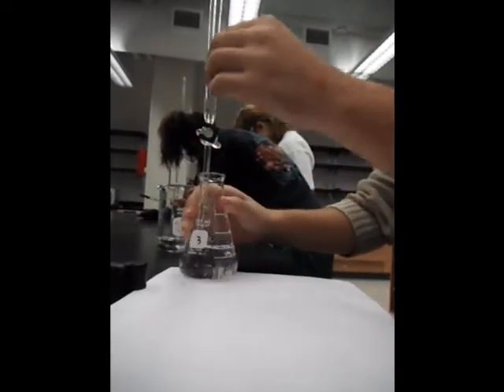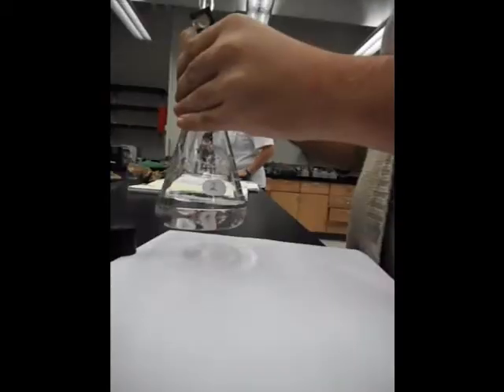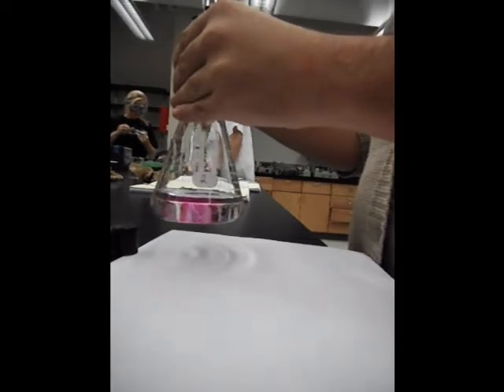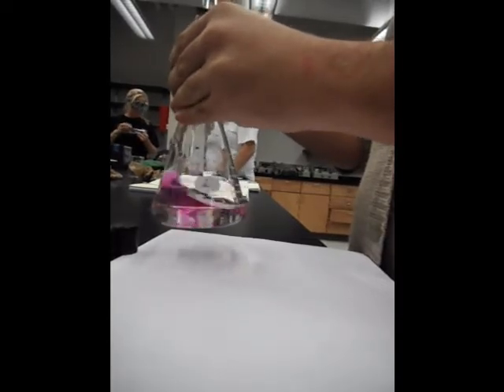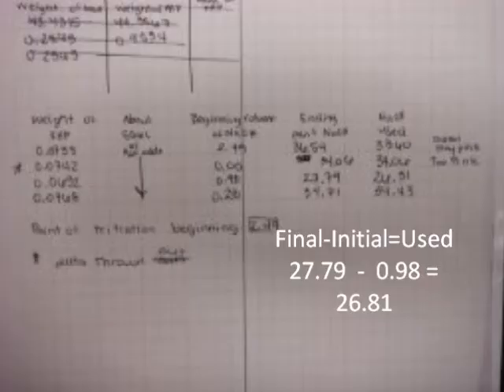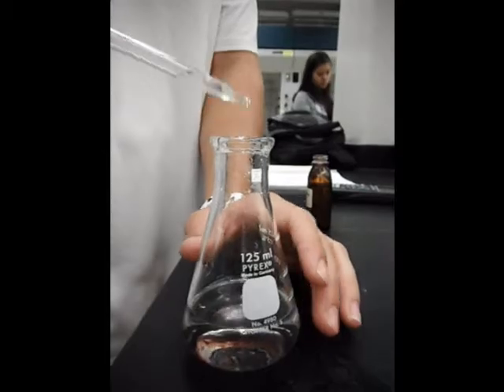You want to make sure that it's close. We're going to show you what happens when you overshoot it. If you put too much solution in, the solution will actually turn pink, and that's not correct. And again, you want to subtract the initial from the final volume.